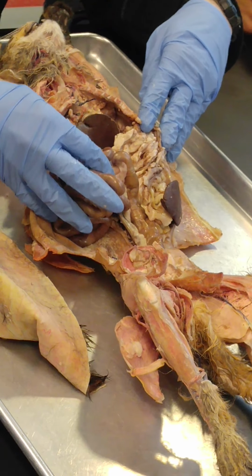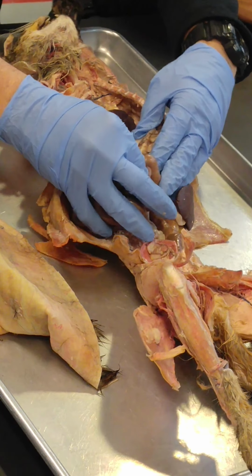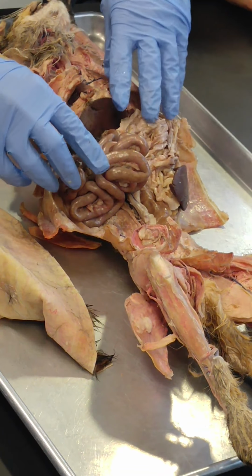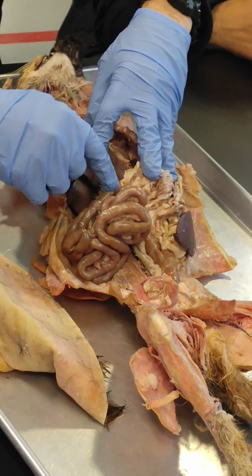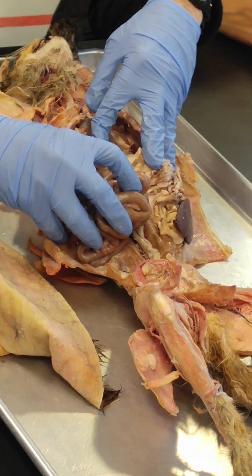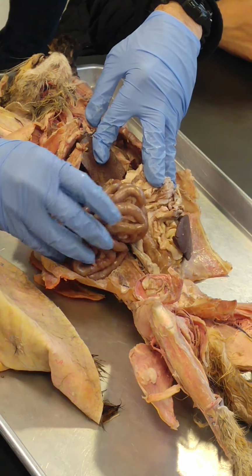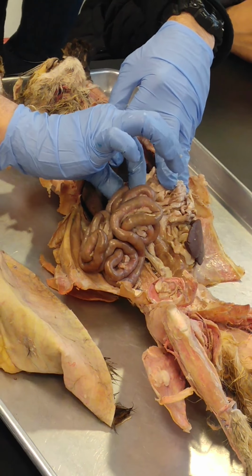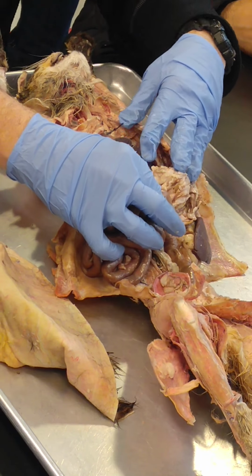So here's what we might do on the test. We might tag the first part, and you tell us it's the duodenum. We might tag the last part, you would tell us it's the ileum. Everything looks the same, macroscopically. The only way to really tell the difference between the duodenum, the jejunum, and the ileum is microscopically. They provide slightly different functions. So if we grabbed in this area, you'd say jejunum. If we grab here, we'd say duodenum. If we grab down here where it ties into the large intestine, we would say ileum. You with me?